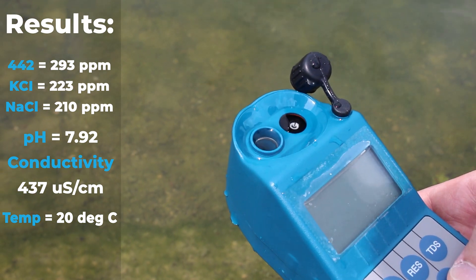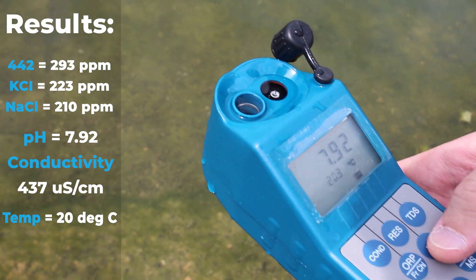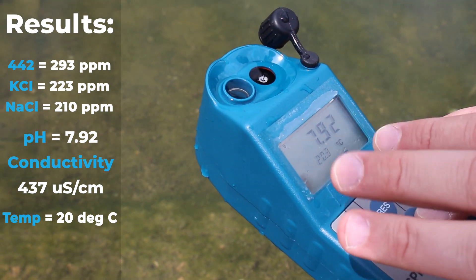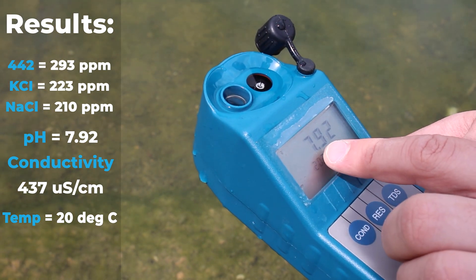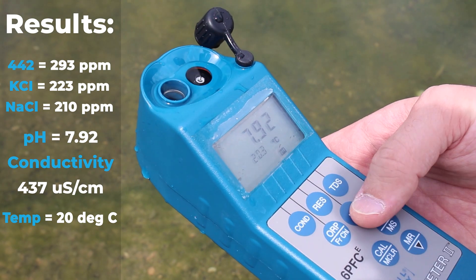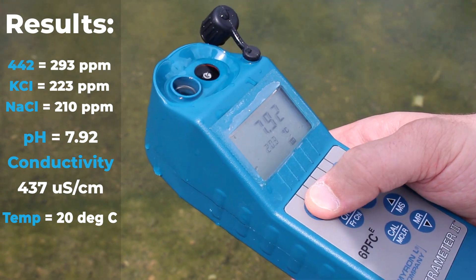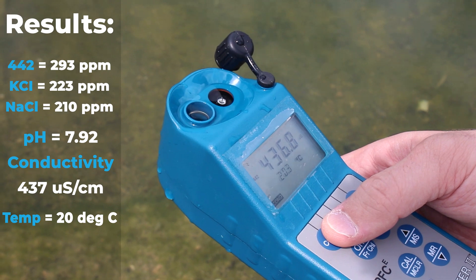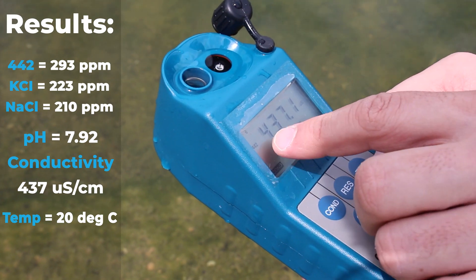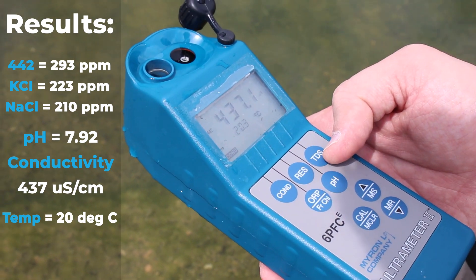If we measure the pH, we can notice that this water body is almost neutral at 7.92 at 20.3 degrees Celsius. The conductivity, which is higher than TDS, reads 437.1 microsiemens per centimeter at the same temperature.